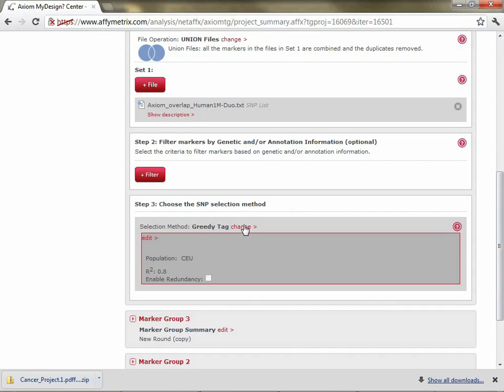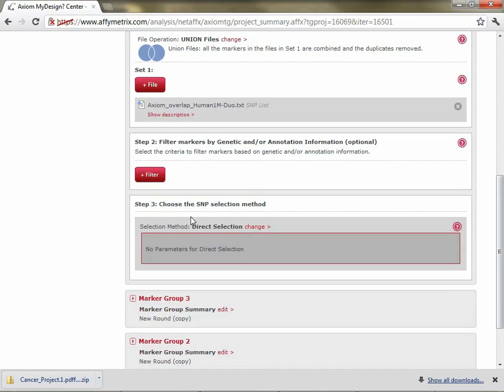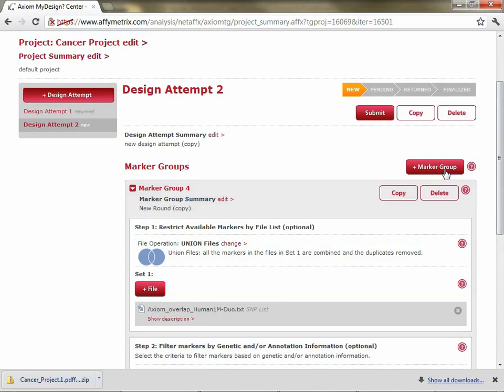So there are 2 different ways you could choose to add additional SNPs to this design attempt. The first would be to change the greedy tag algorithm to something like best tag. That will clearly increase the number of SNPs that you have. Because it's best tag, it will try to get 1 marker for each one from the Illumina array, and since that's 1 million, this is probably going to overshoot the array. So we'll probably go back and change this to just the direct selection to select the validated markers. That's one option. The other option is to add another marker group that contains additional criteria for another set of SNPs that you choose to add to the design attempt.